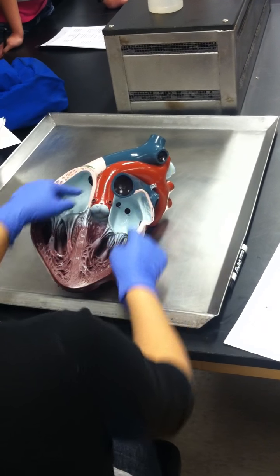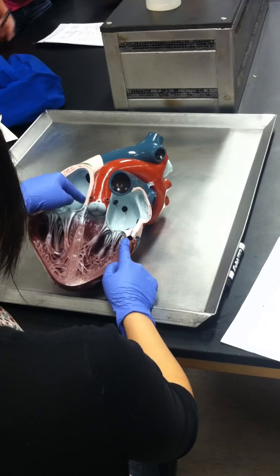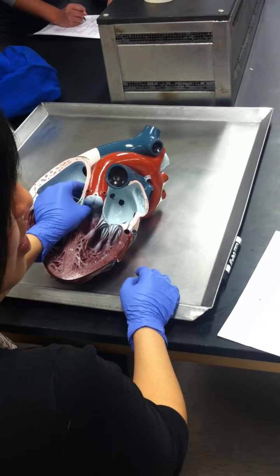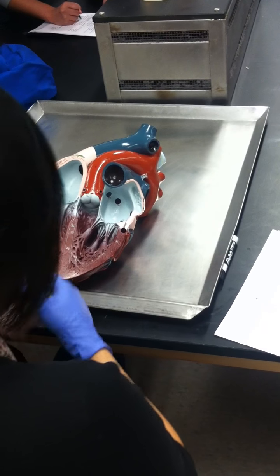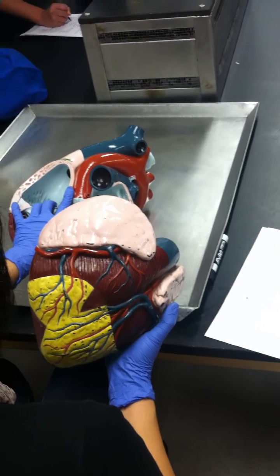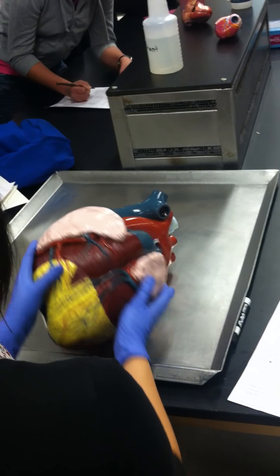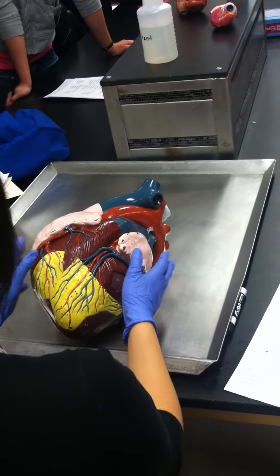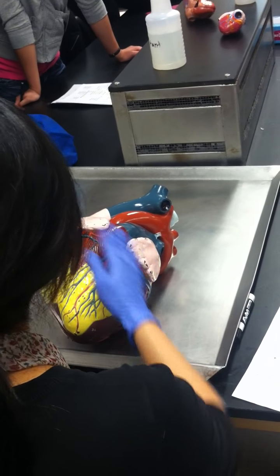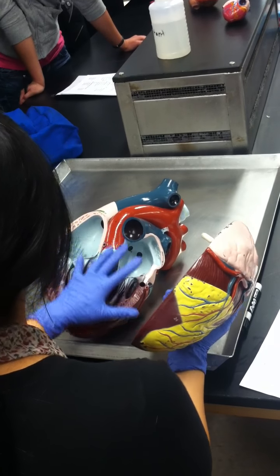So that's this structure. That's just a developmentally significant structure. Make sure you know where it's located. In which chamber is it located? Right atrium. Very good. All right. So that's all the internal structures I want you guys to focus on. We don't have a foramen ovale right now, because it's only seen in the embryo, so you probably won't see that on your cats. If you want to, you could try slicing your cats down the middle to see the internal structures.